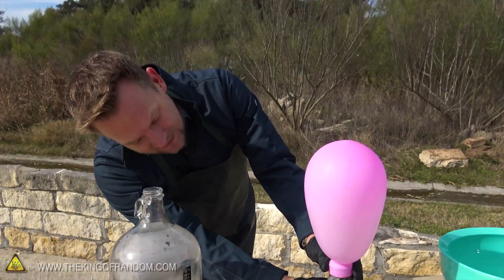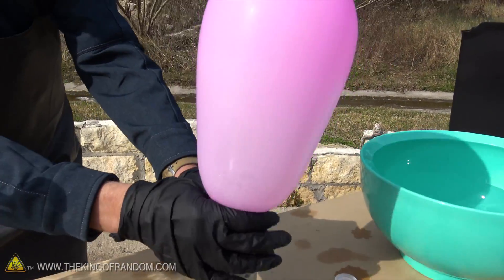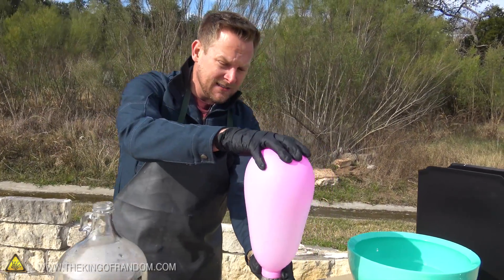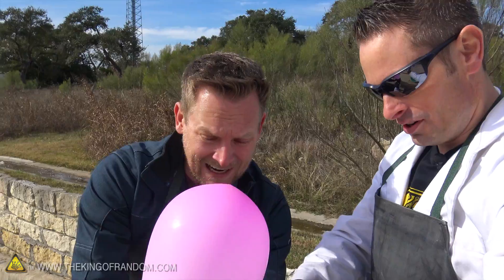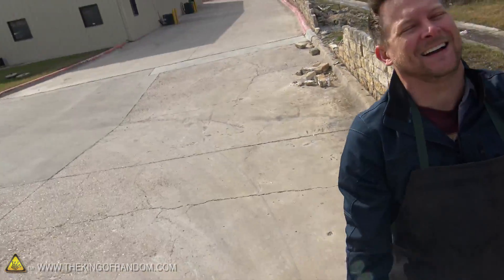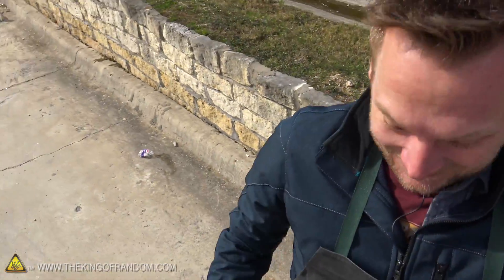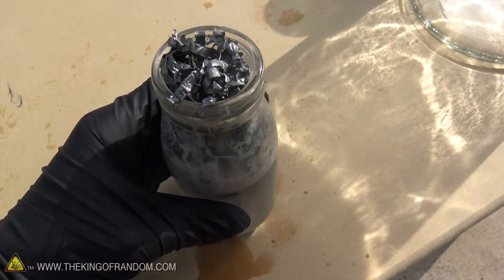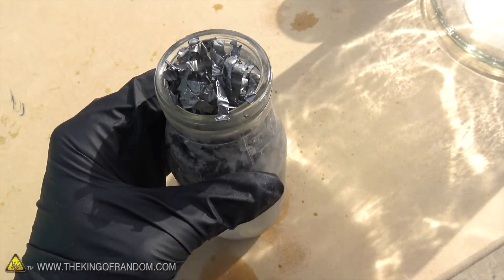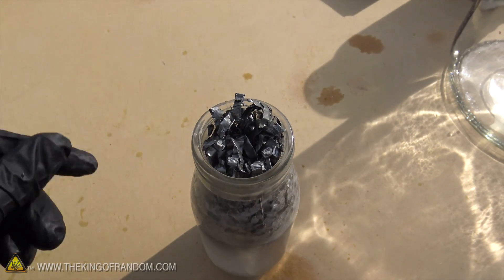It's really really hot. That balloon is getting huge. This reaction just took off after about two minutes — it just went crazy and it's really hot. So go ahead and pull the balloon off. Oh, the shame — smell all that hydrogen we just lost. That's the smell of failure. It took about two minutes of small bubbling and then the reaction just took off in an instant. That balloon blew up really crazy, so we've got to do that again.